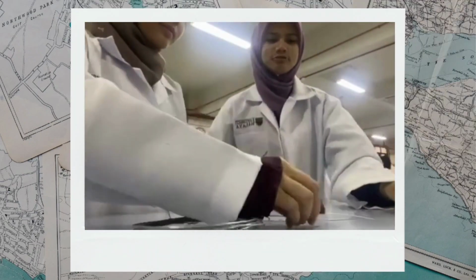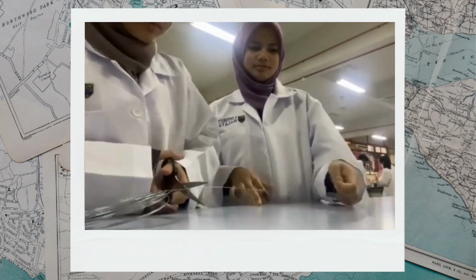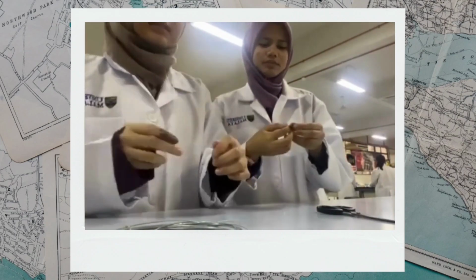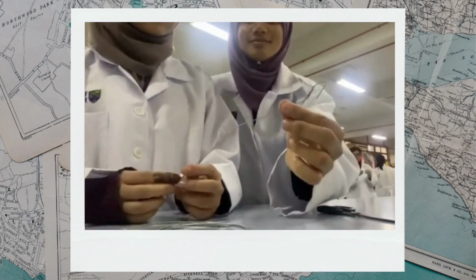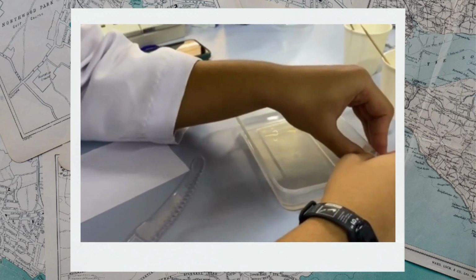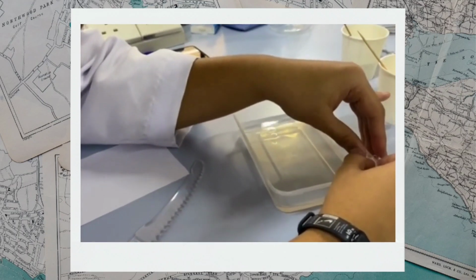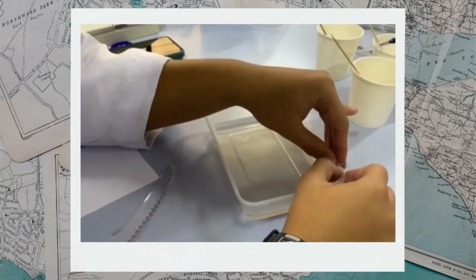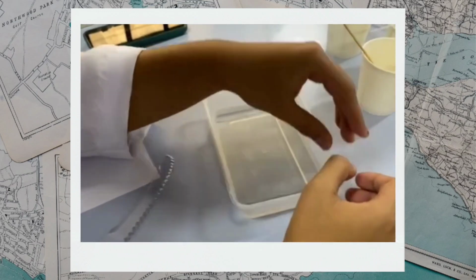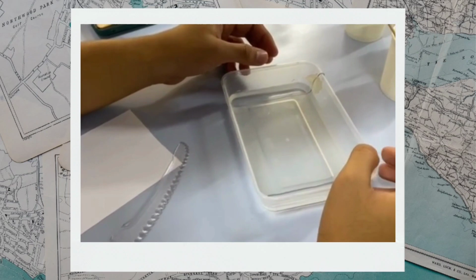To make your electrodes, bend each piece of stainless steel wire so that it fits inside the box along its width and hooks over the side. Place one electrode along the top end of the gel and one at the bottom end, using tape on the outside of the box if needed to secure them in place. These will be the positive and negative electrodes.